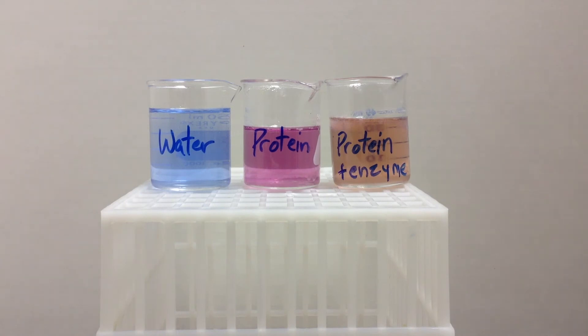Comparing all of these beakers shows that the beaker we placed our enzyme into does still contain some protein. However, much of that protein has been broken apart into smaller molecules, and those smaller molecules include individual amino acids and the shorter chains we call polypeptides.